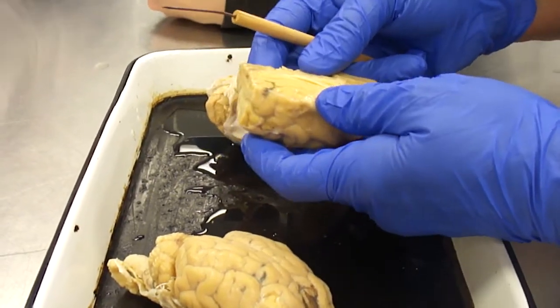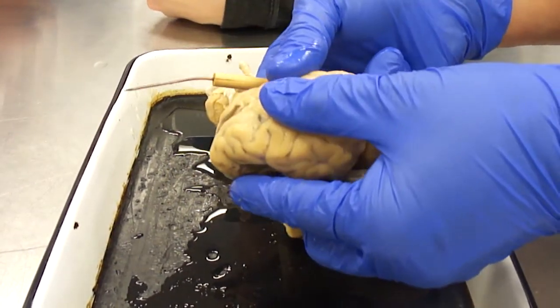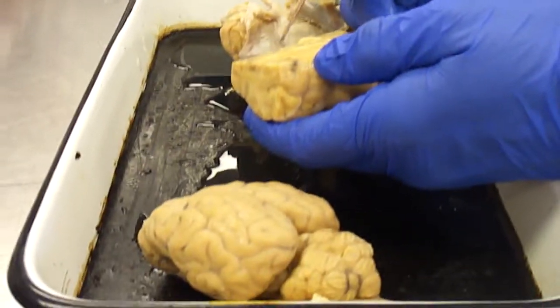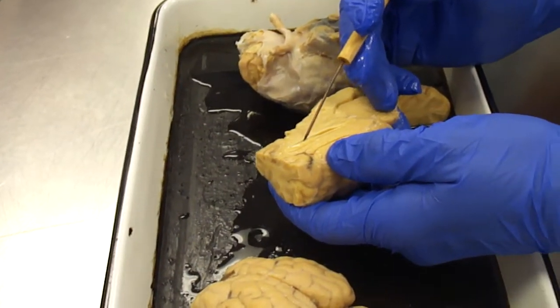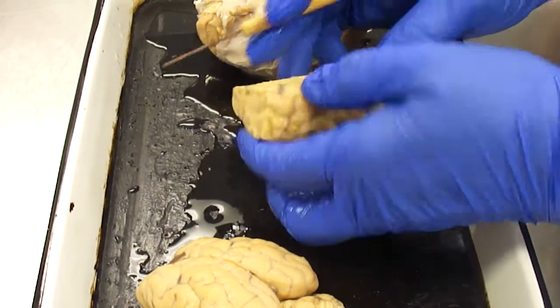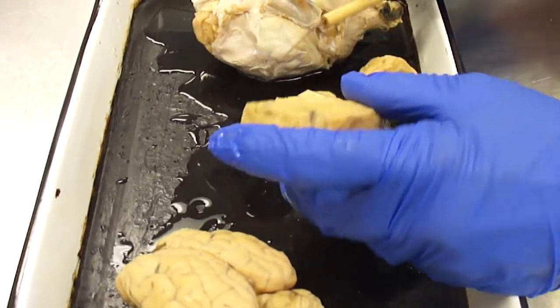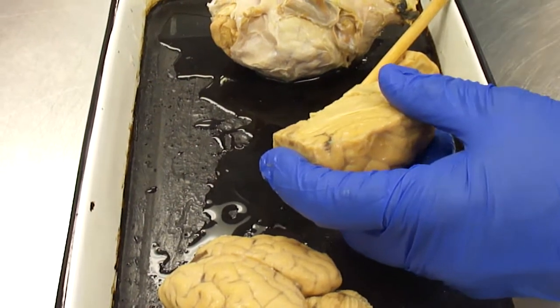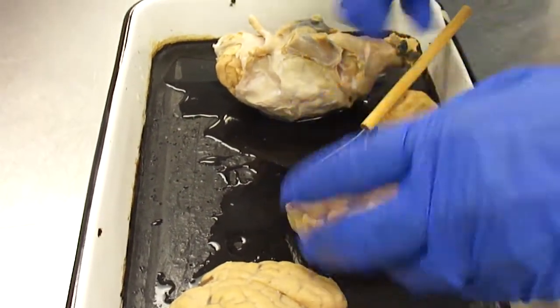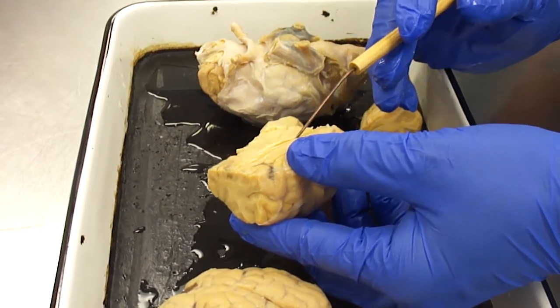All right, so the hemispheres, the right and the left cerebral hemispheres, are connected at the bottom of the longitudinal fissure by a tissue called the corpus callosum. The corpus callosum is where the nerve tracts cross from right to left. I don't know if you have heard before, but if you have an injury to the right side of your head, it's most often the left side that gets affected, because the nerve tracts cross from right to left, not all of them, but some of them, and so that's an issue. So this corpus callosum is where the nerve tracts cross from right to left in the brain.